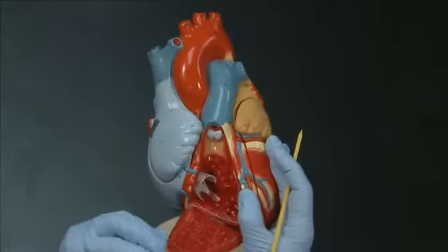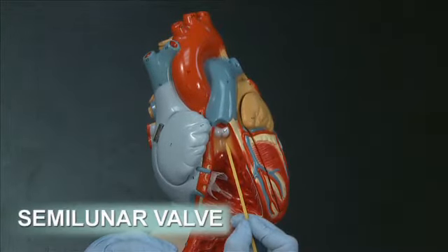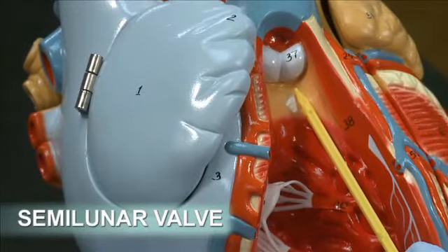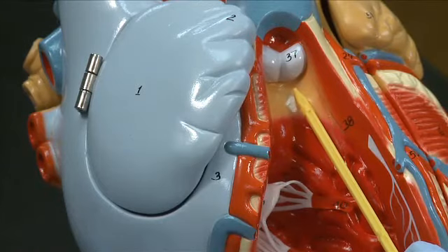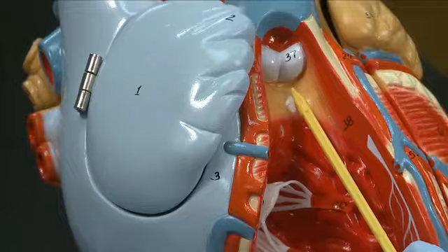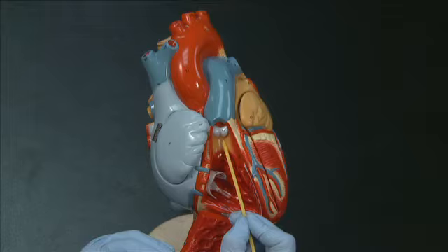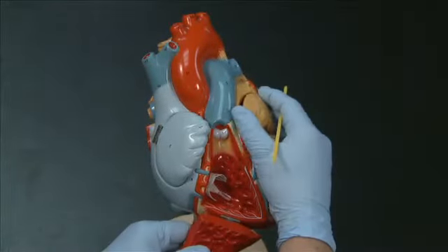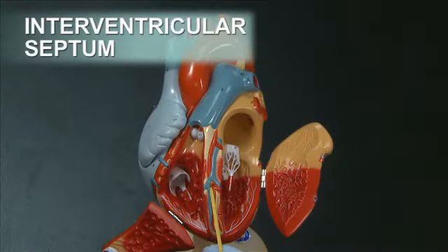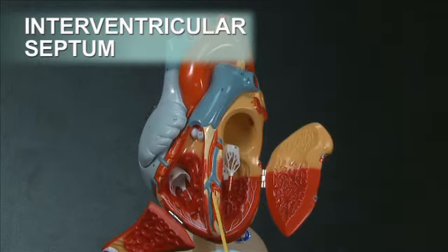The valves between the ventricles and the systemic circulation are called semilunar valves because the cusps resemble half moons. The semilunar valve between the right ventricle and the pulmonary trunk is the pulmonary semilunar valve, and the corresponding valve on the left side of the heart is the aortic semilunar valve. The last structure we'll point out is the interventricular septum, which is the thick muscular wall that separates the right and left ventricles.